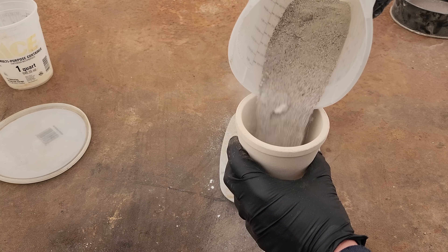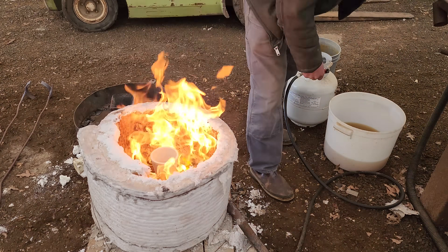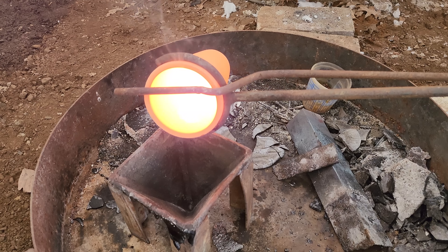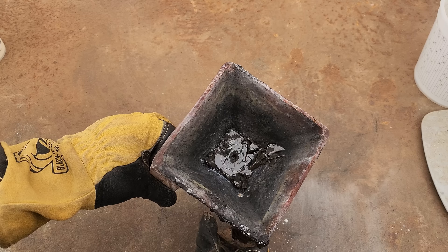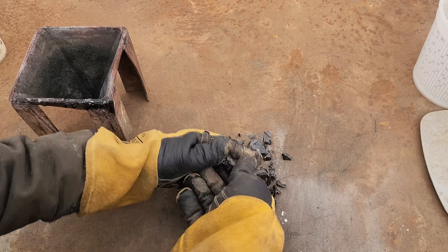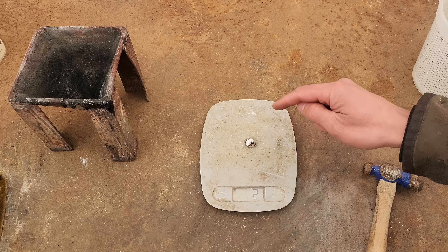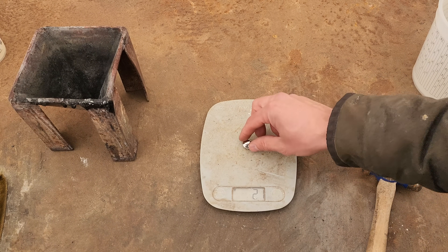What's going to happen is you're going to get a little piece of bismuth metal floating along liquid — it's going to attach itself to the platinum, palladium, or rhodium. Once it's attached it forms an alloy, so you have a bismuth-platinum alloy. That will reduce the melting point and then it will all be liquid and collect down at the bottom of our crucible. We're hoping for a nice little bismuth button — and there it is, just a beautiful button. 21 grams, just about what you'd expect. If we reduced every single bismuth atom out of that oxide we'd end up with about 22 grams, so we are right there. It worked really, really well.